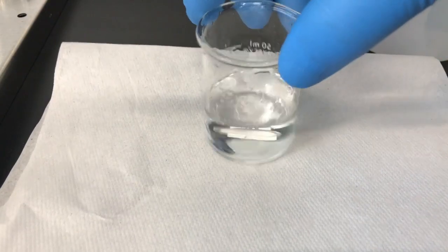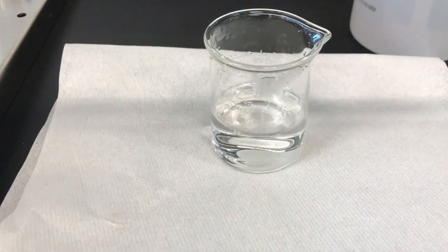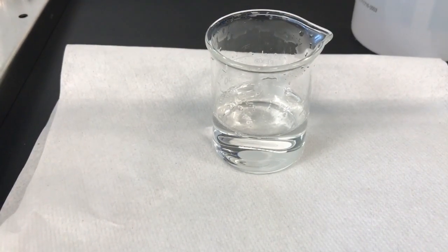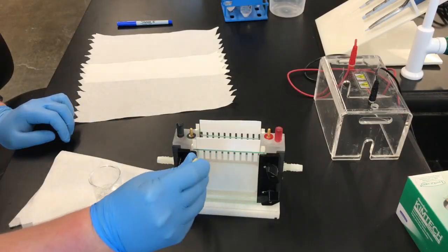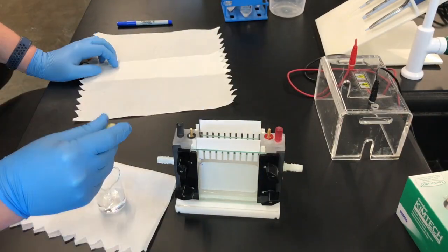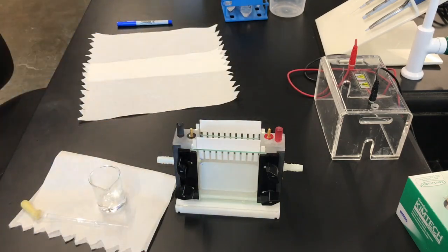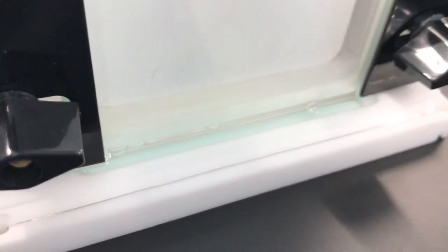Once it's fully dissolved, the TA will come around and pipette the agarose plug onto your apparatus. The agarose will fill up this bottom well here and it will solidify in about 15 minutes.